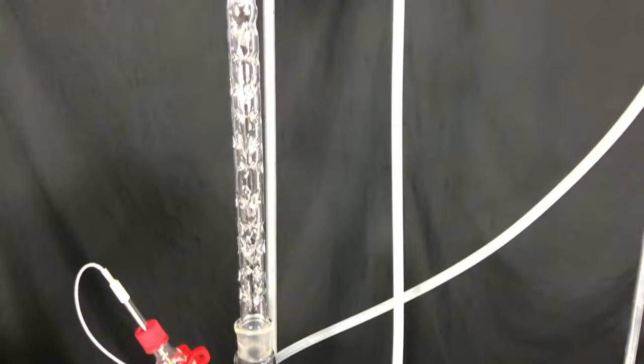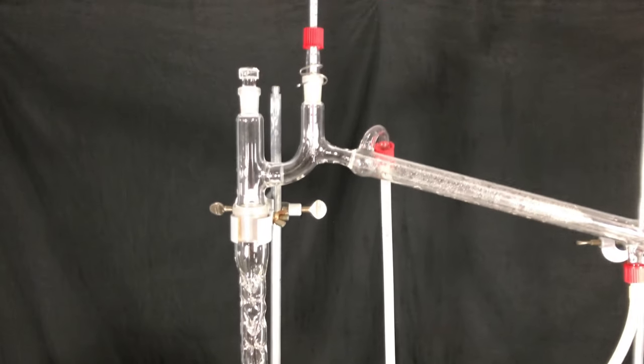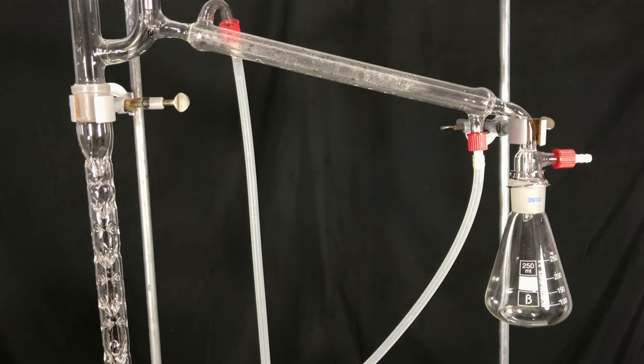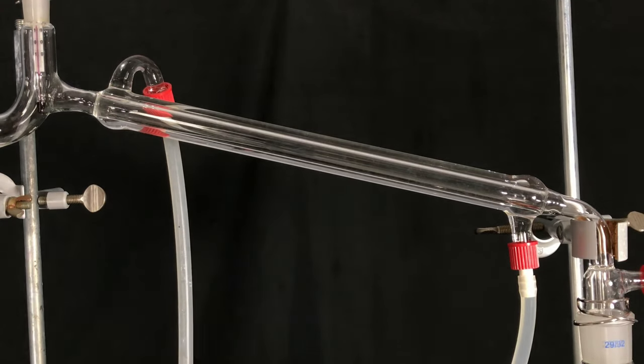The reflux condenser was afterwards switched out for a fractional distillation setup. The condenser was filled with water and we started distilling.